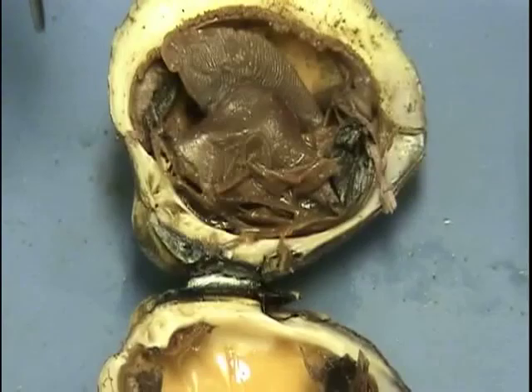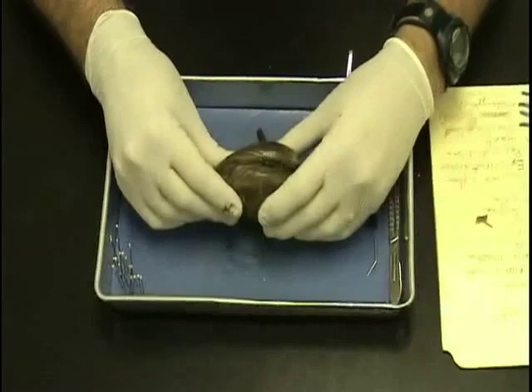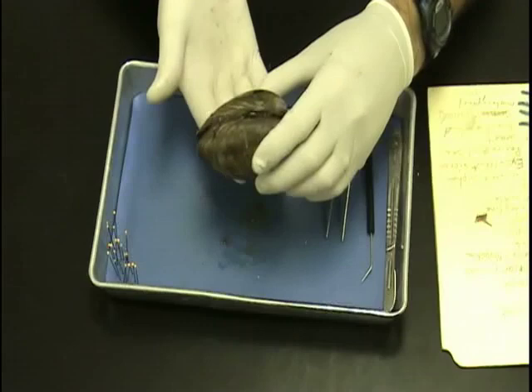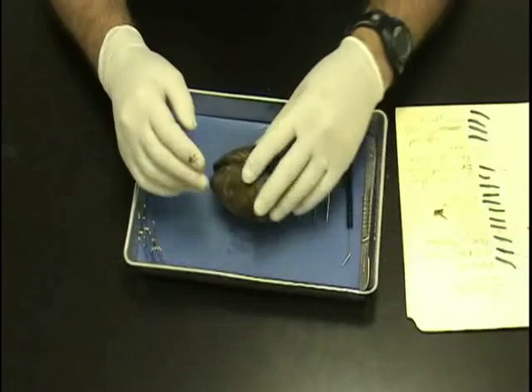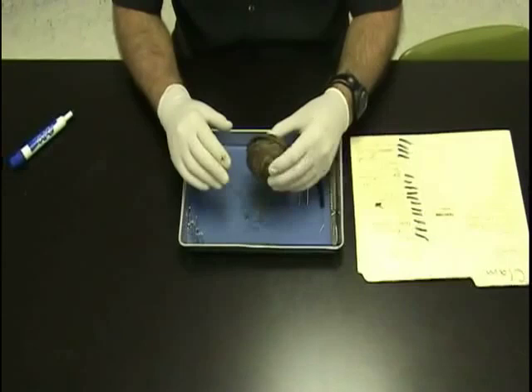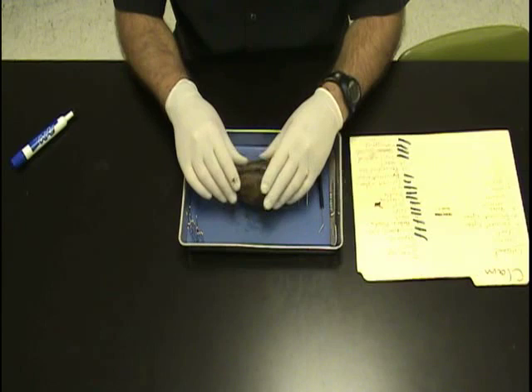Let's go over the external again. Where the umbo is — anterior. Opposite to the umbo — posterior. Where it hinges together — dorsal. The opening, which is the bottom side — ventral. This is a bivalve, also in the phylum mollusca. Now we're all finished with this. We want to clean up our station and throw this away. You may not keep the valves — a lot of students want to keep the valves, but they will go in the garbage. You will study your notes and take-home notes, study this video and also your PowerPoint, and take your take-home quiz. You may use your notes. Good luck.